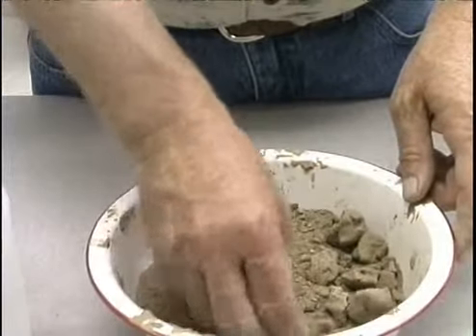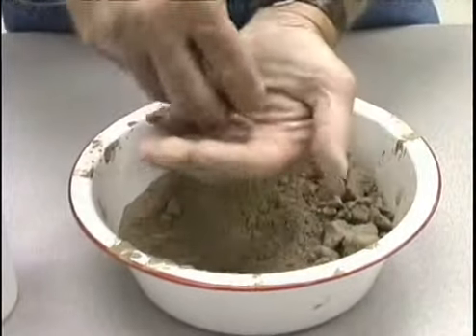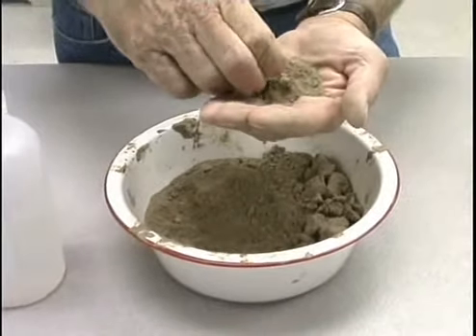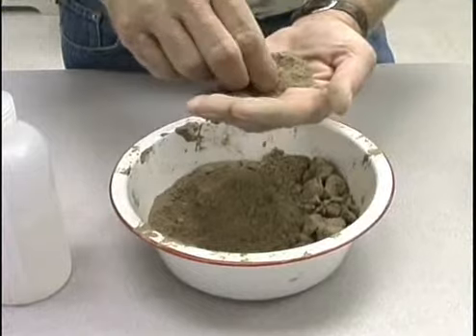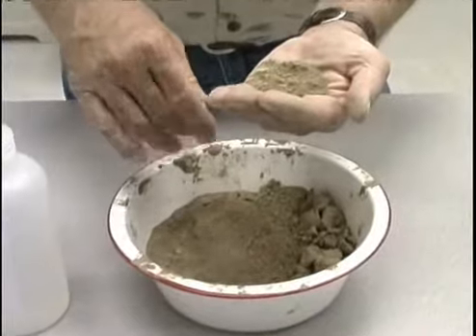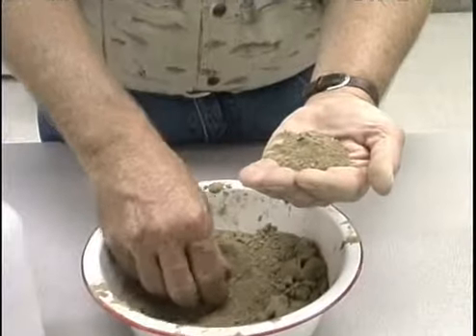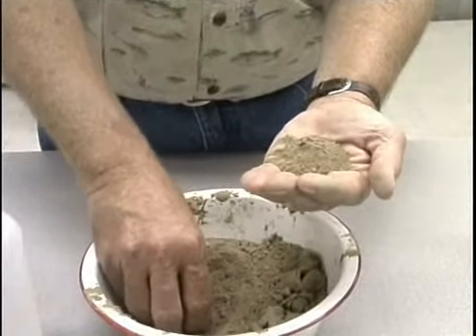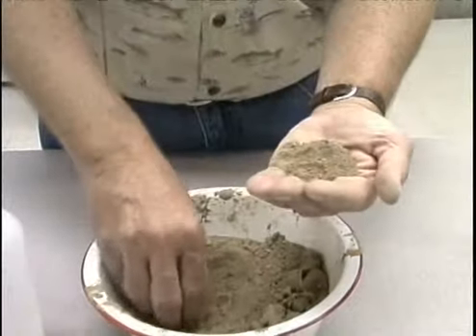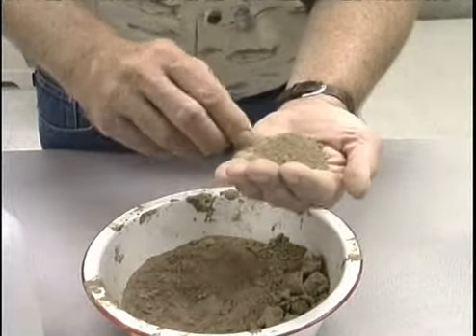So to repeat the procedure that I did on the first sample, I will take approximately 25 grams of soil again. Now there will be some small PEDs or aggregates in the soil. If you cannot get this to moisten and form into a ball, then we may have to use some method of breaking these aggregates or PEDs down, crushing that. And in the laboratory we use a mortar and a pestle, and I'll demonstrate that on a later soil sample. So I'm going to start with my palm full of soil.